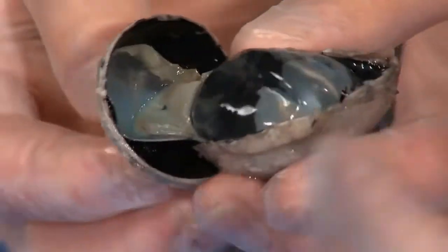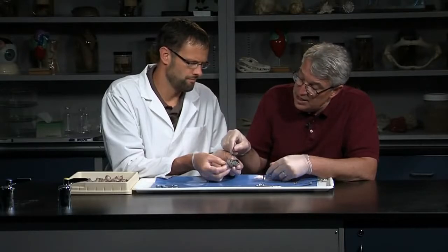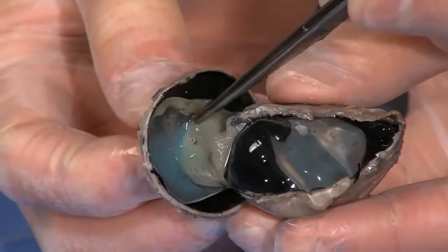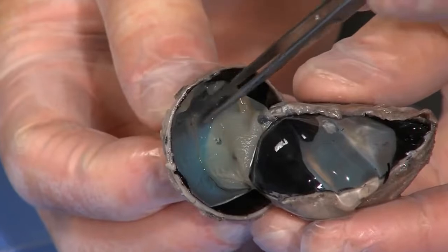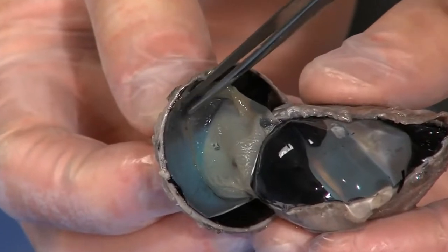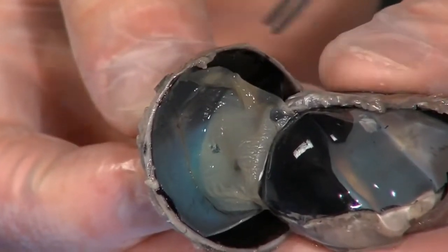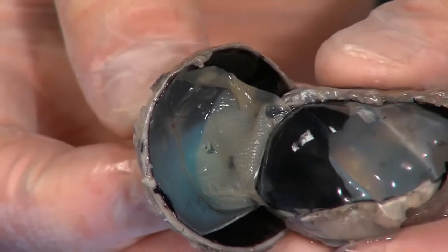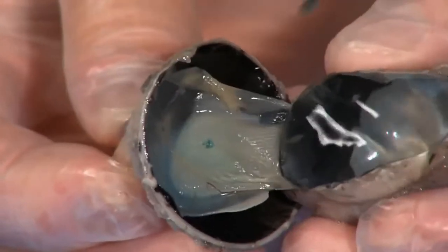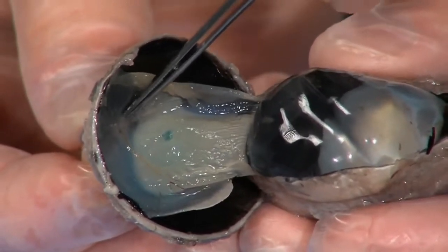The retina is nervous tissue; it is continuous with the optic nerve. You can see how you might get a detached retina — the retina is not very securely attached in any way to the inside of the eyeball. Instead, it just spreads around, and the only place it is attached is at the optic nerve.